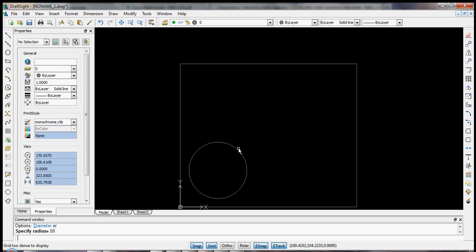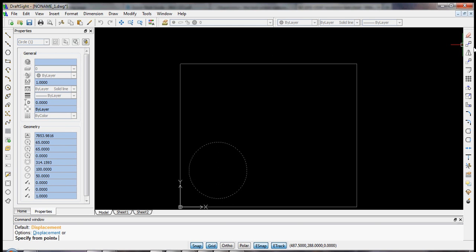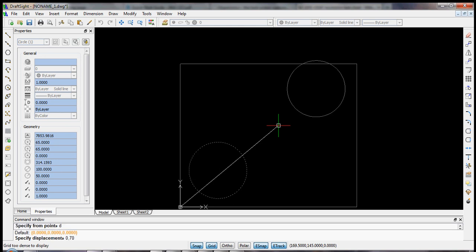So let's now copy this element. We can click it. We can type the word copy. Again, we also could go up onto the right toolbar, and up here you see copy. And so we can take any point. We could snap to the center point, or we can simply say we want to displace it vertically. And I'd say it'd be good to have a 20 millimeter distance between the two. So again, 50 plus 20 would be a horizontal displacement of 0 and a vertical displacement of 70 millimeters. So let's just type D for displacement, 0, 70, enter.